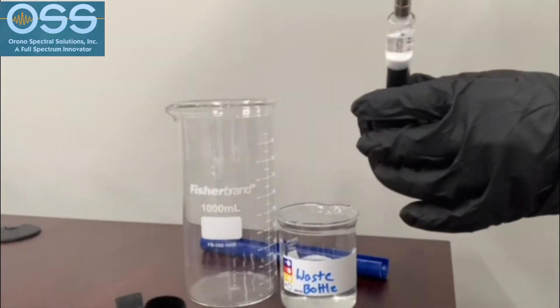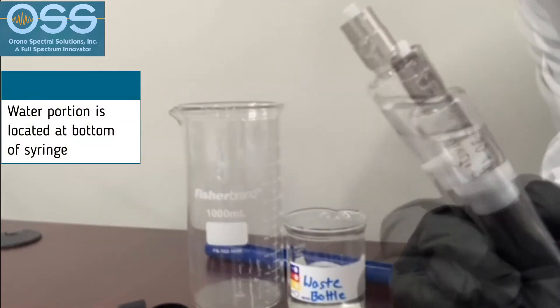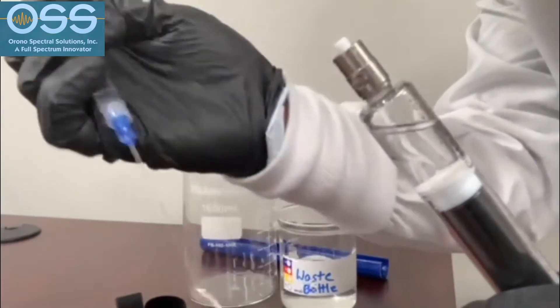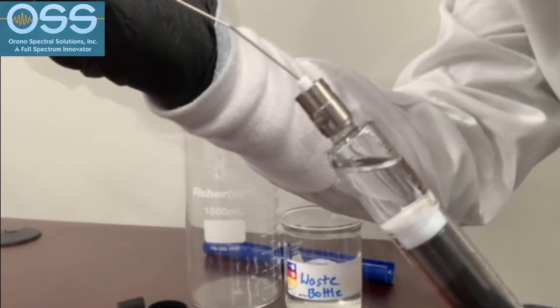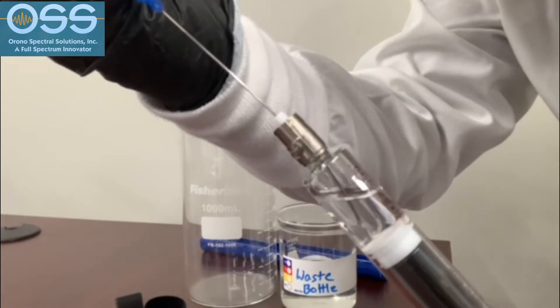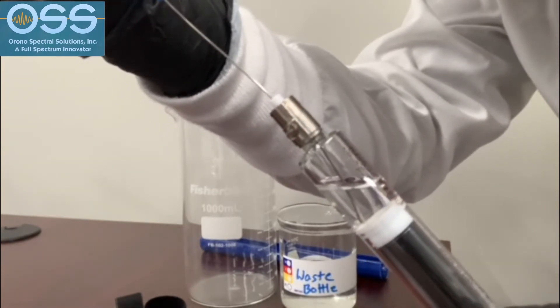Now invert the syringe so that the water portion, which is the heavier component, is at the bottom of the syringe near the plunger tip. We are now going to remove the water from the sample by using the glass syringe with the custom tip. Insert the tip directly into the water and slowly extract the water until it is no longer present in the sample.